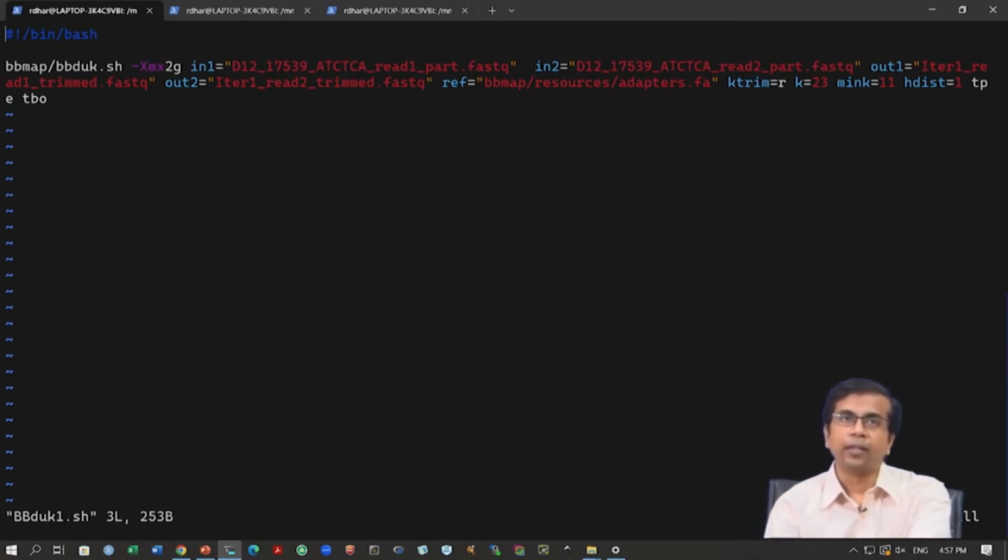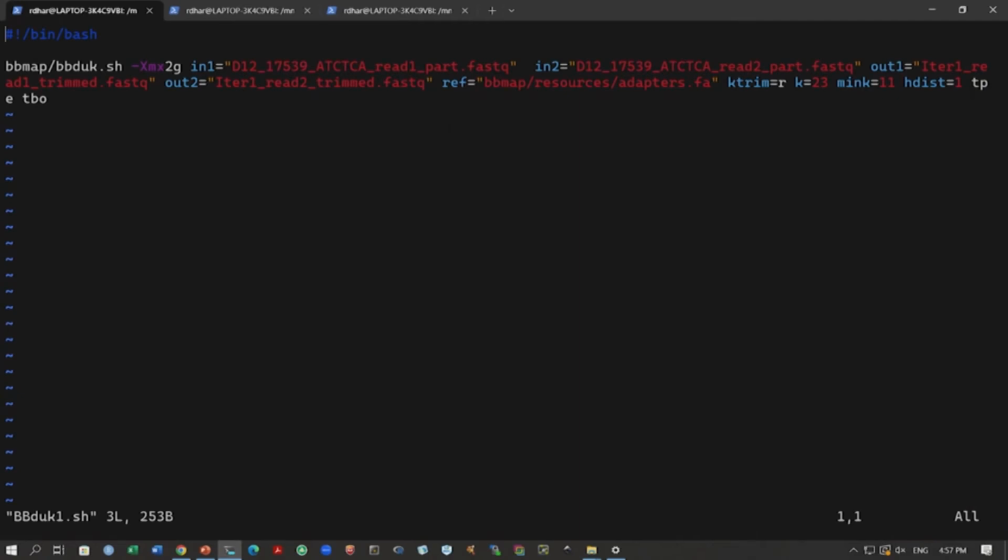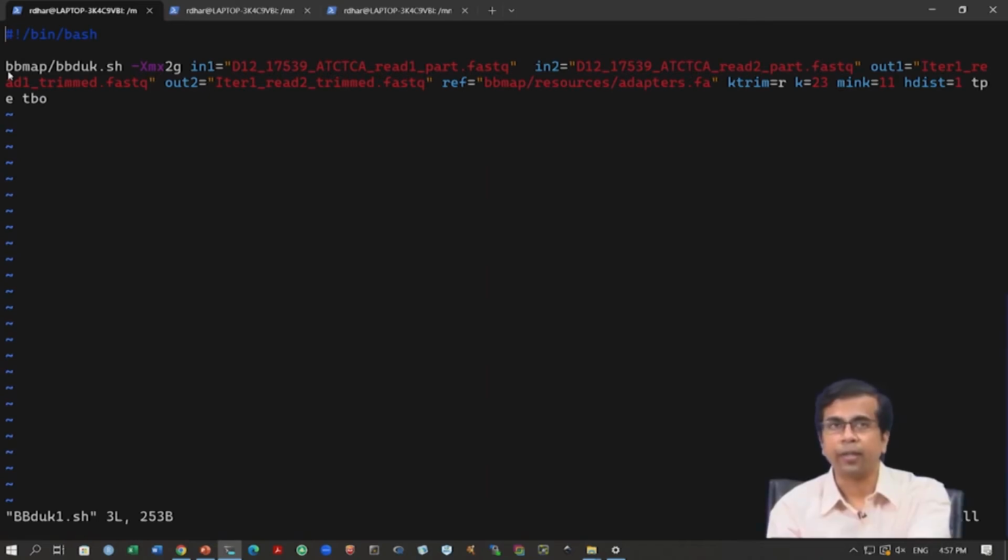Okay. So, if you are working on the command line, you can run this as a script itself, but if you want to just run in the terminal, you can copy this command and run in the terminal. So, this is what we will do. We will copy this command and we will run in the terminal. Before we do that, I will explain what this command actually means.